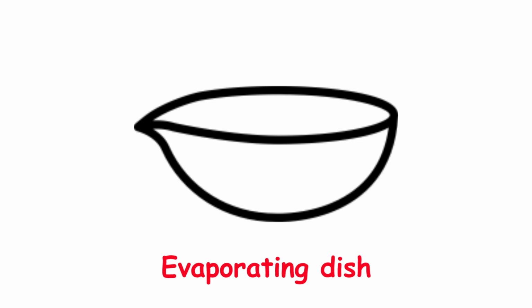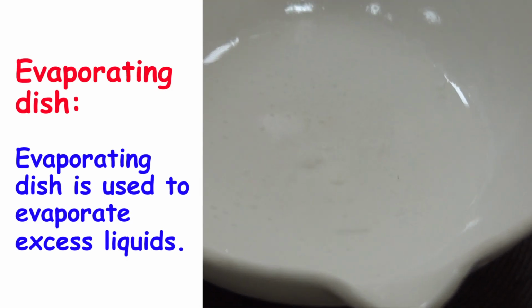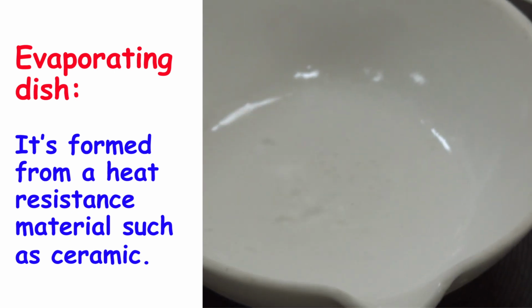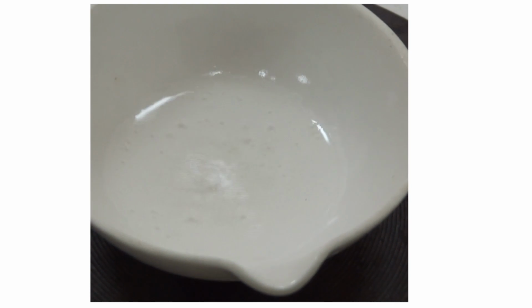Evaporating dish. An evaporating dish is used to evaporate excess liquids. It's formed from a heat resistant material such as ceramic. Look how water evaporates in order to recuperate salt alone.